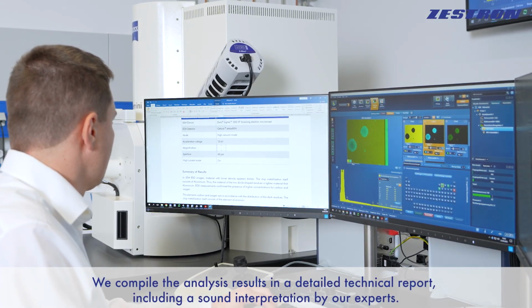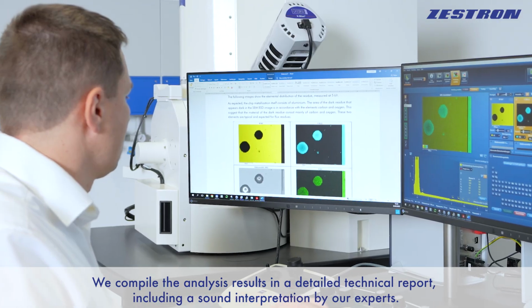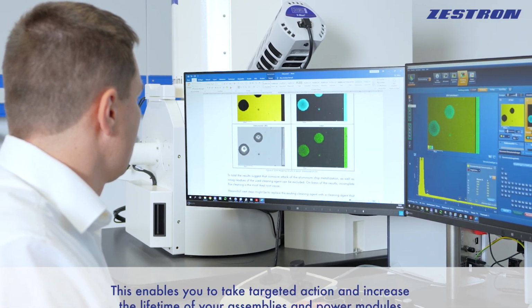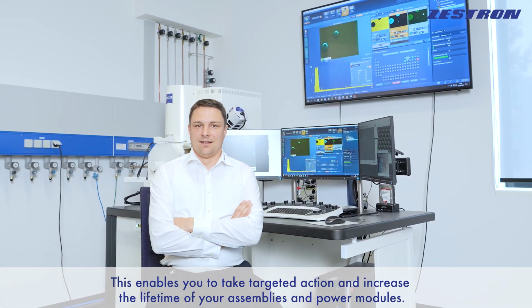We compile the analysis results in a detailed technical report, including a sound interpretation by our experts. This enables you to take targeted action and increase the lifetime of your assemblies and power modules.